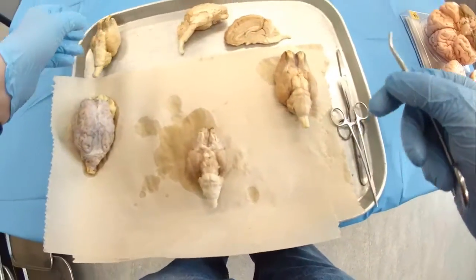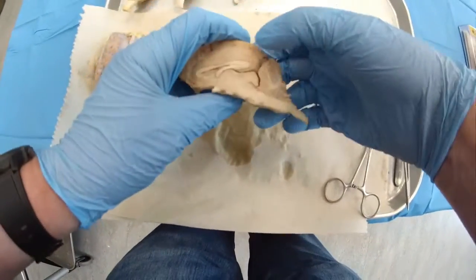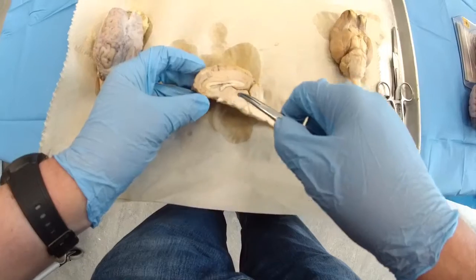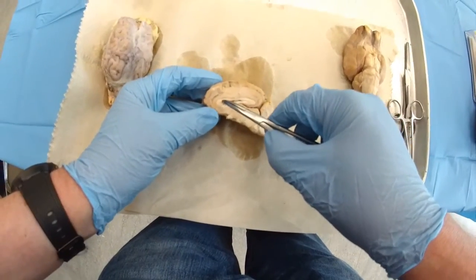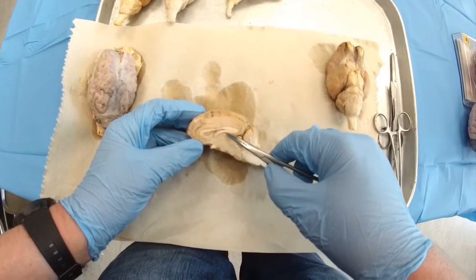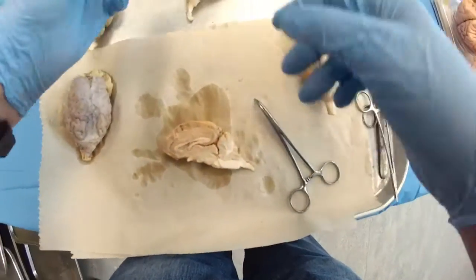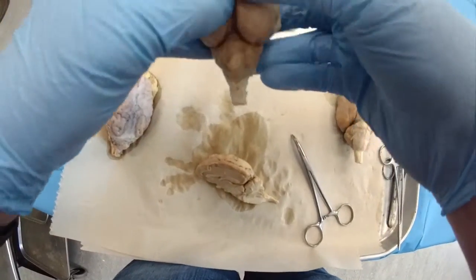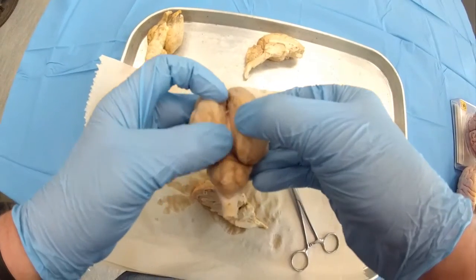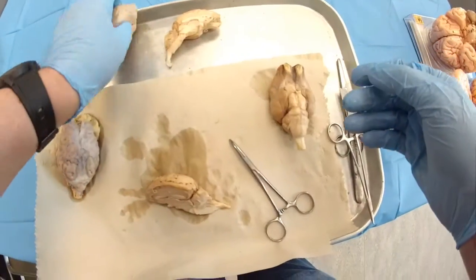So next step, we will do a sagittal cut, and I already prepared this. And the structures that you observe, right in the middle, you could see the corpus callosum. This is the junction between two hemispheres. In the untouched structure, you actually can see the corpus callosum. You see, this is the junction between two hemispheres. You can actually clearly see that.